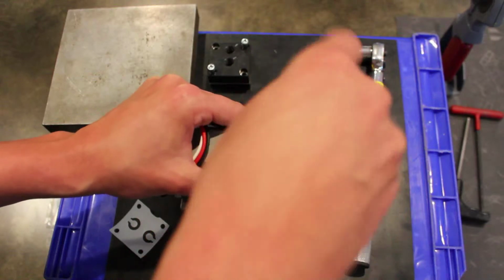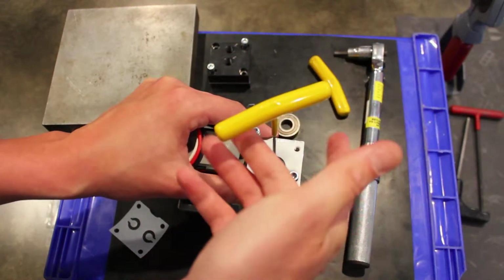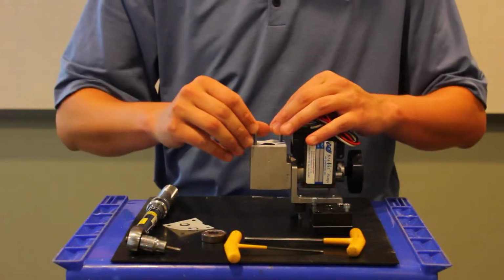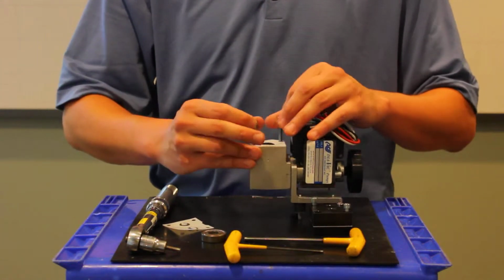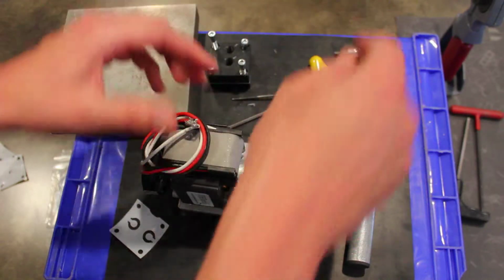Bolts are on there. They're going to keep it nice and centered, and just want to get that hand tight. Okay, remove our head bolts and we'll place those back in there. So now our diaphragm's on.